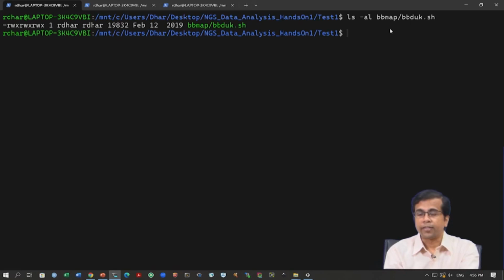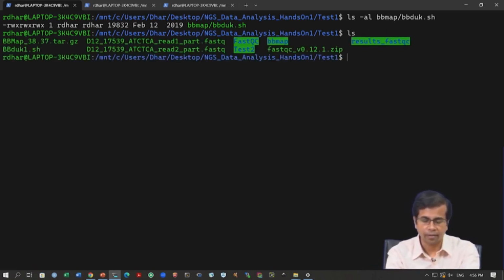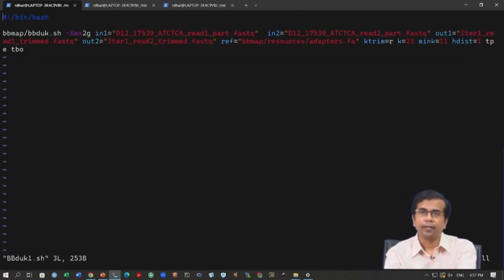Okay. So, as I was saying, we have tested different parameter values for this data, and we have optimized which parameters actually work the best for these files. I have stored this in a file here. Let us look at this. I have stored it in something called BBduk1.sh, just to distinguish from the bbduk.sh, and it actually stores the full command that we will be using.